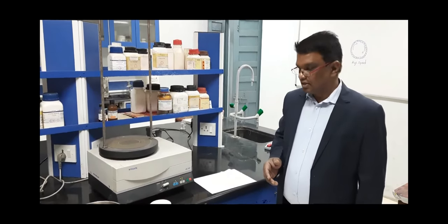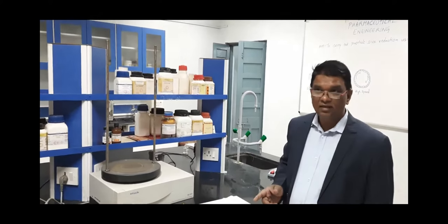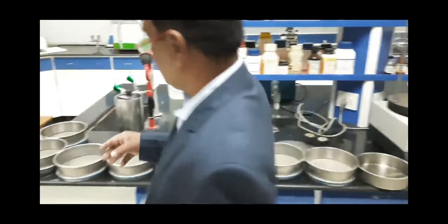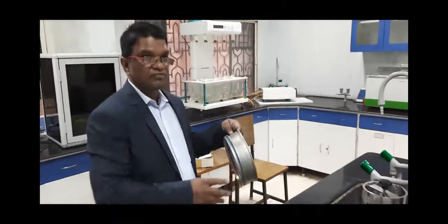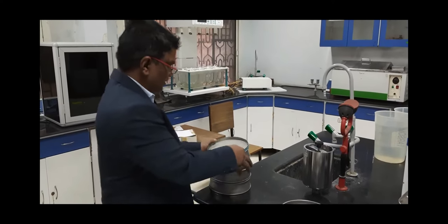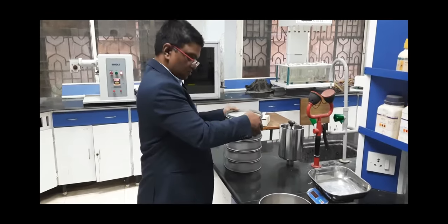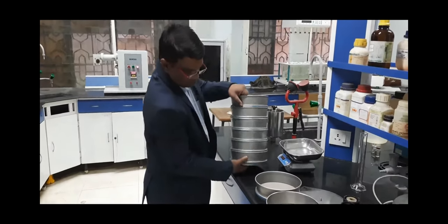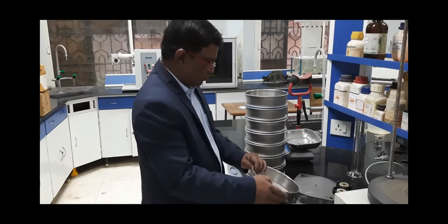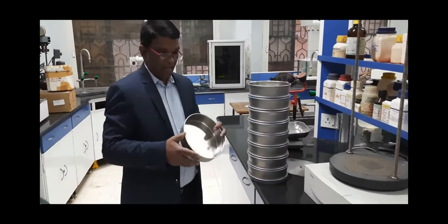Before starting particle size reduction of the ground material, we have to perform size analysis. We are using a sieve shaker apparatus with different sizes of sieves. The sieve sizes are: number 20, number 30, number 40, number 60, number 80, number 100, number 200, and a pan which is kept at the bottom.